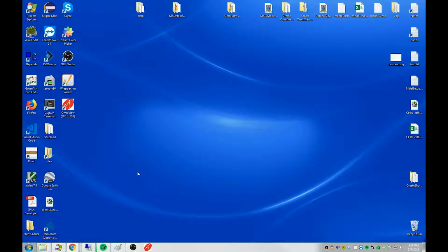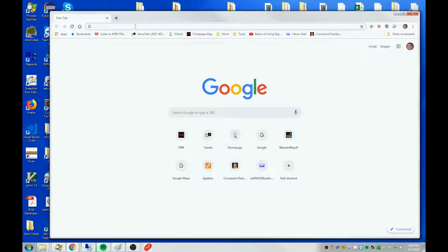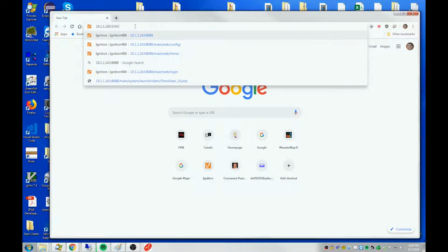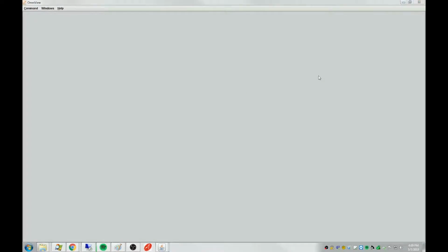Some of you have versions of the software where we did not provide the small website for you to do this. So for those of you, you can still start a client by, again, running a browser and going to, this time, instead of 8080, we're going to go to 8088, which is the URL of the Ignition gateway page. OmniView is written with Ignition. Ignition is a widely used software platform out there, and it provides the following website. There's a lot of things that they have on their web page here that we do not recommend you use, but you can start a client by finding OmniView here and clicking the launch button. And there again, you see the client starting.